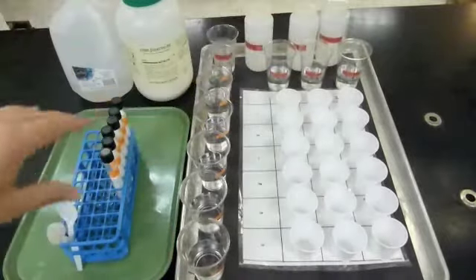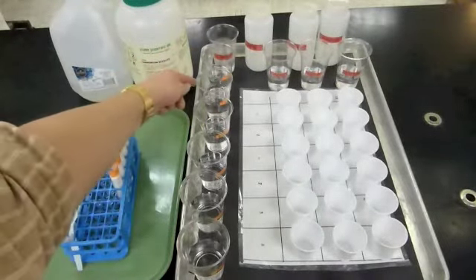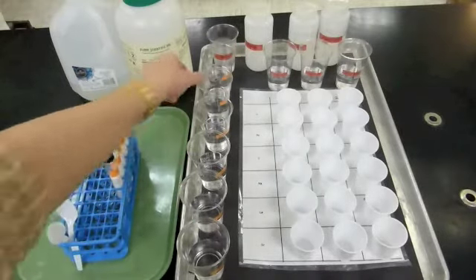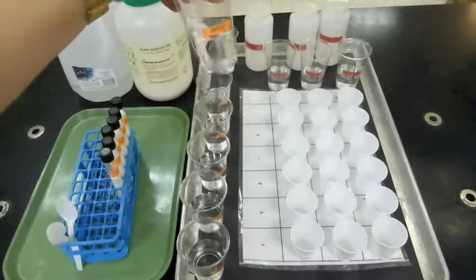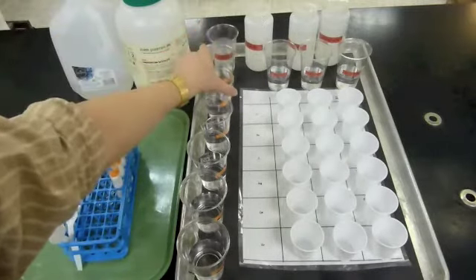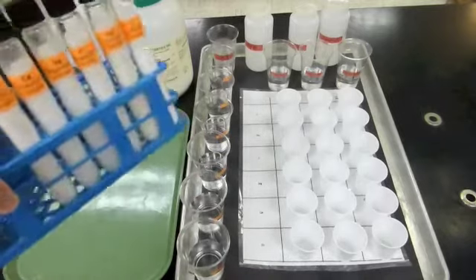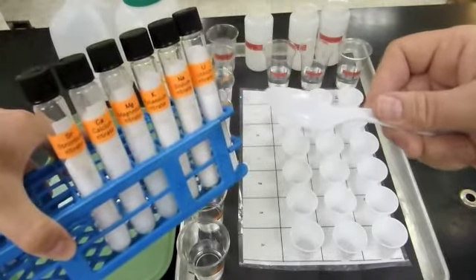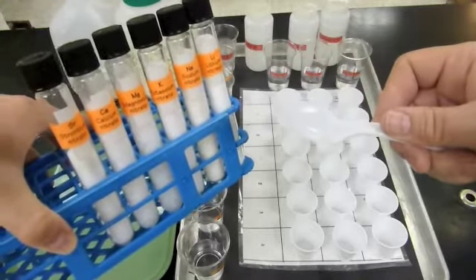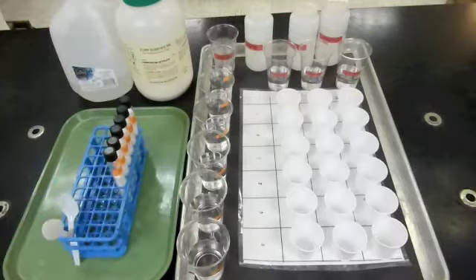When you go to make the mixtures for your experiment, fill up these cups half filled with water. They are matching the elements that you're testing. There's one label for lithium and one for sodium and potassium and so on. Use the test tubes and use a clean spoon, 1 or 2 good scoops. If you use the spoon again, make sure to clean it off. Just wipe it clean with a paper towel before you use it again and make those mixtures.